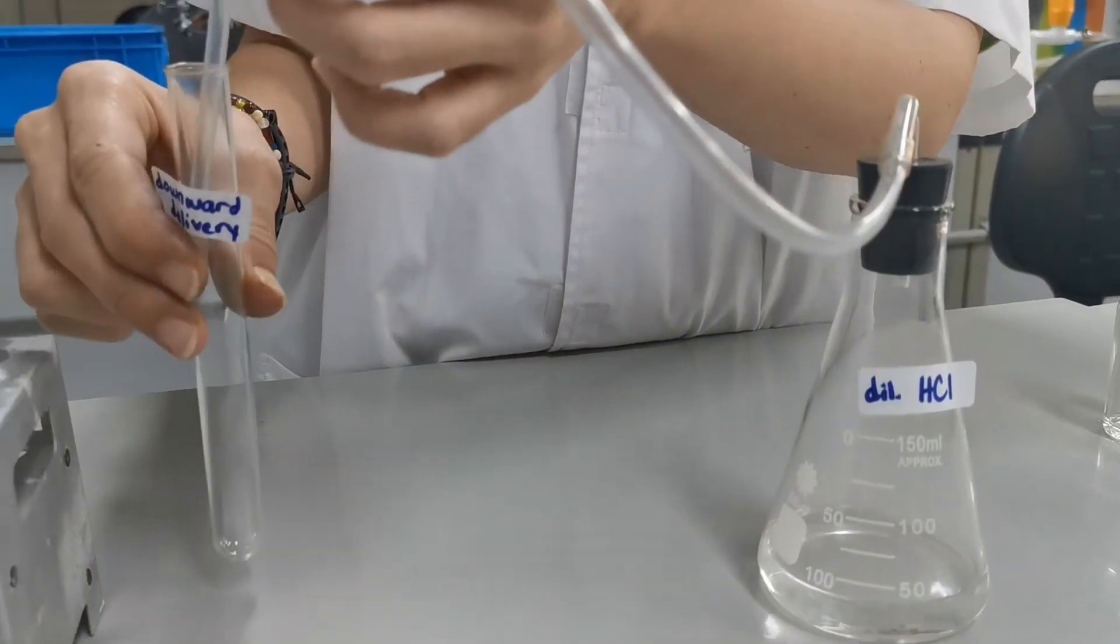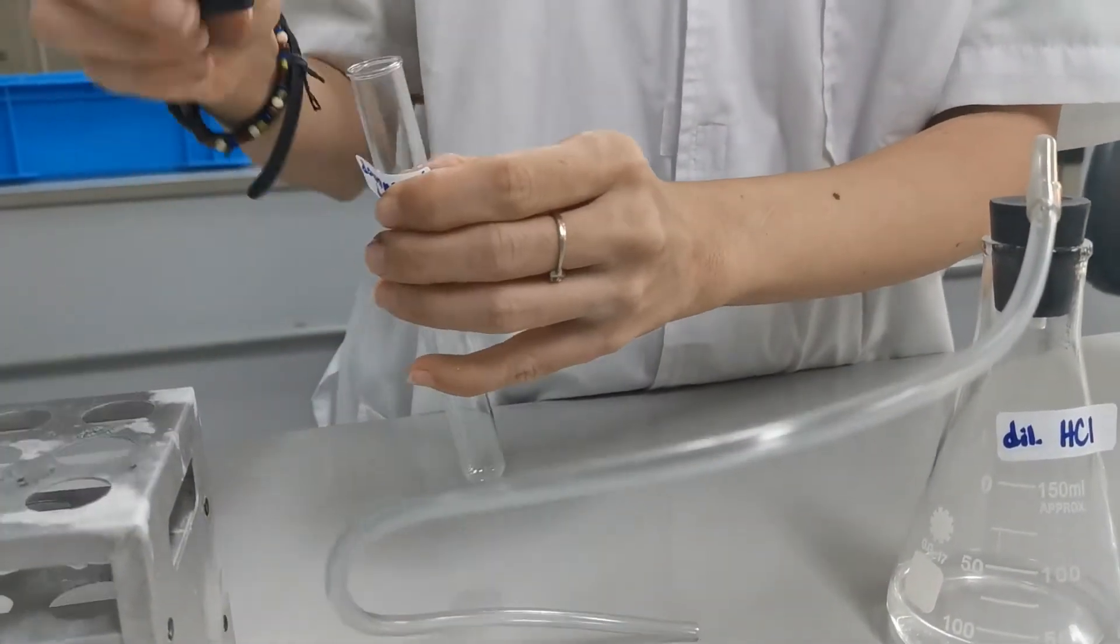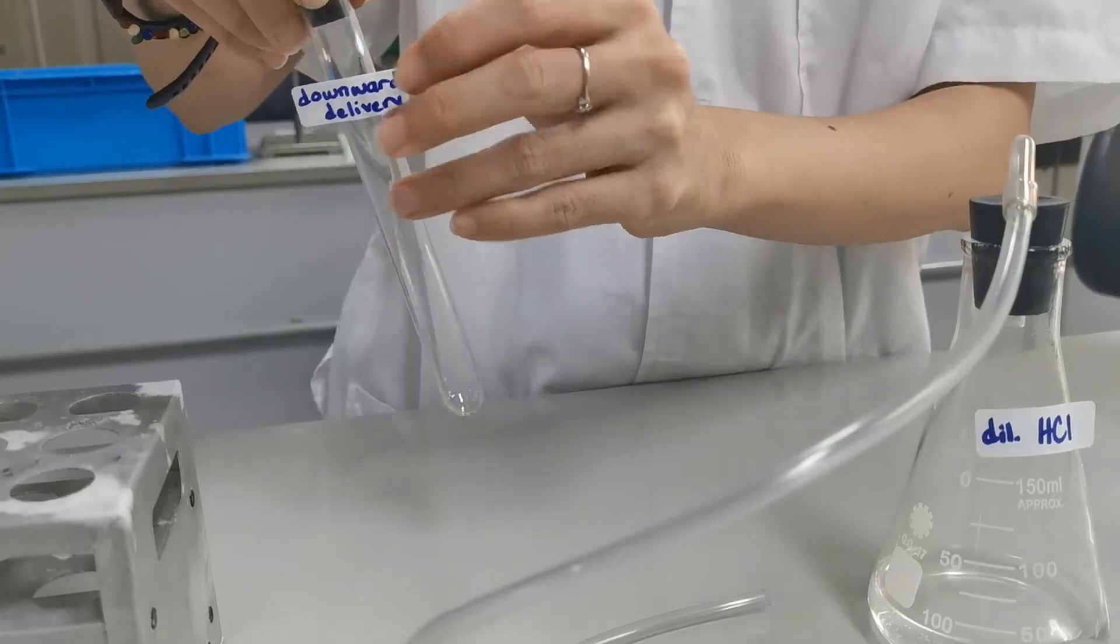Okay, reaction has ended. So I'm going to put a stopper in this tube. Turn off.